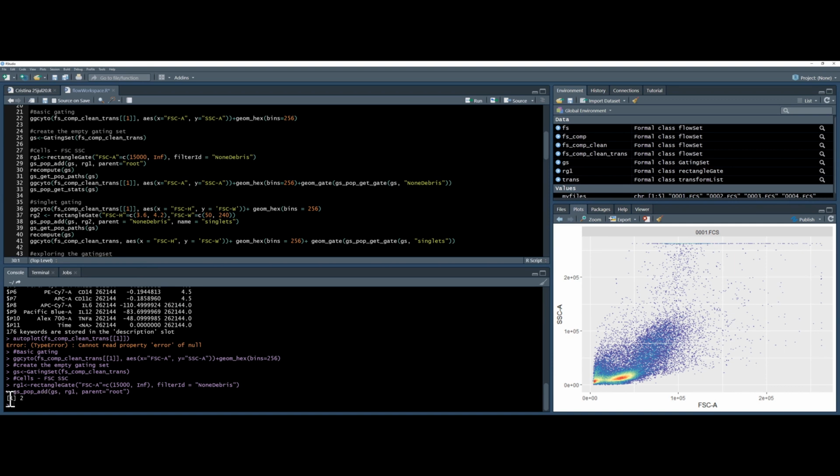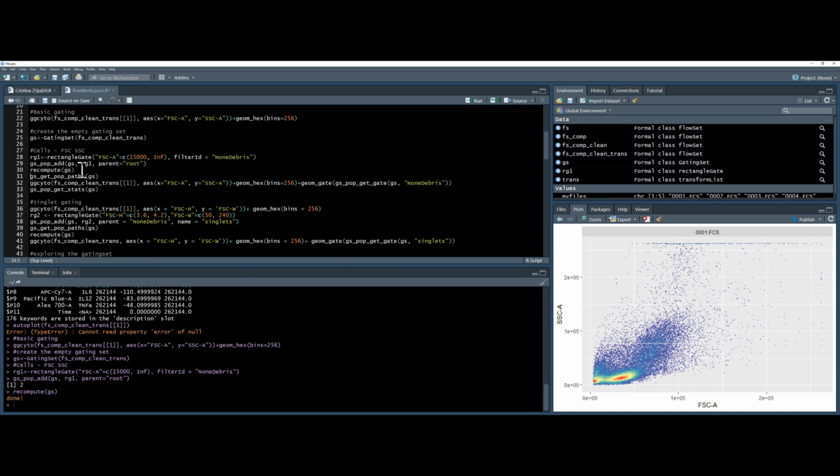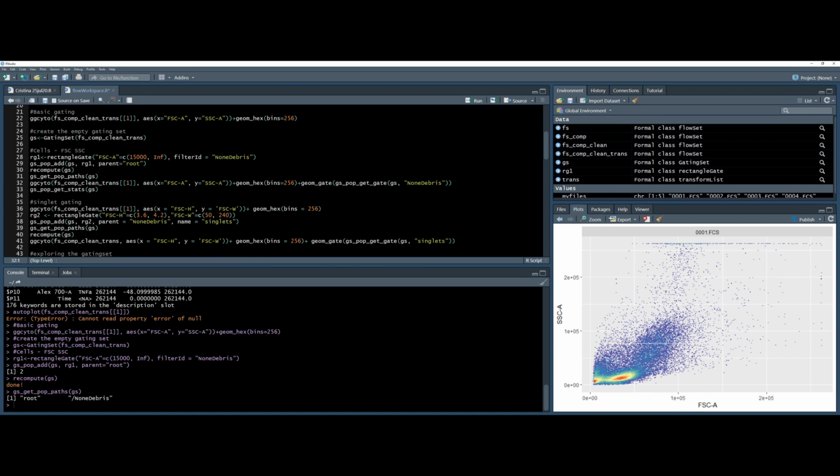And you can see it says I now have 2 gates. This recompute command recalculates all the statistics based on these gates, and that's done. So now if I use this gating set get population paths, that will tell me what gates I have. So I currently have root and non-debris, and I can visualize them using ggcyto.